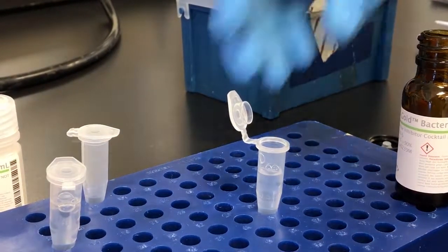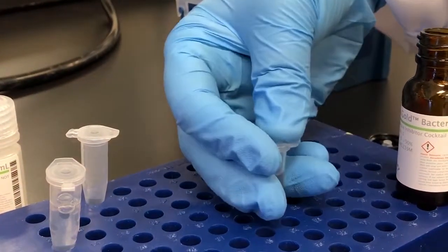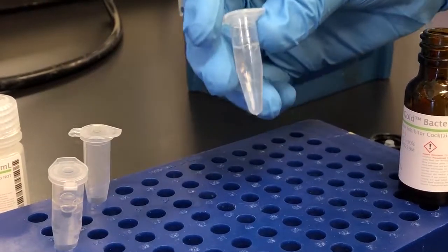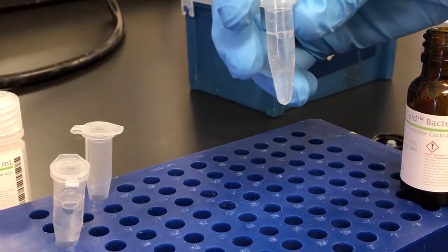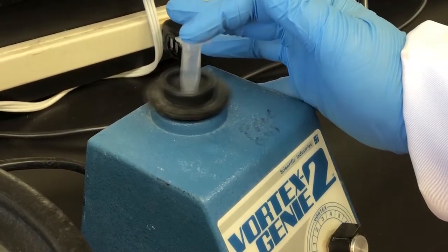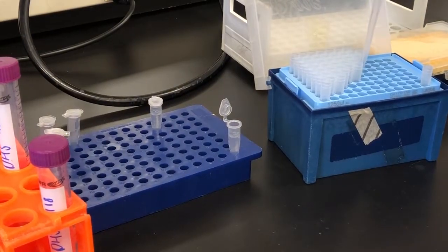Use caution when deciding whether or not to use EDTA since it inhibits some of the chromatography that might be utilized downstream. After both components are added I lightly vortex to mix the two components together.